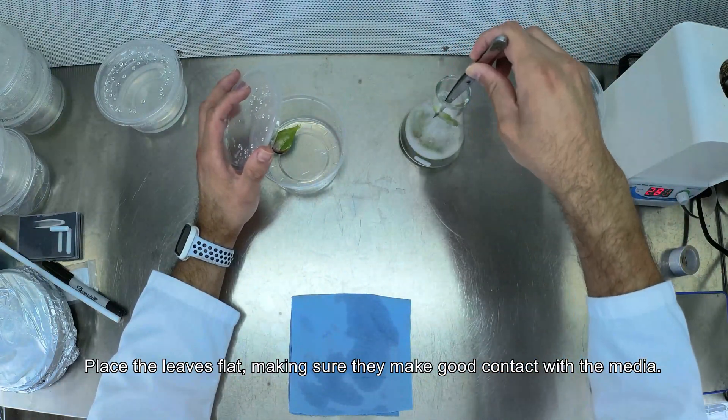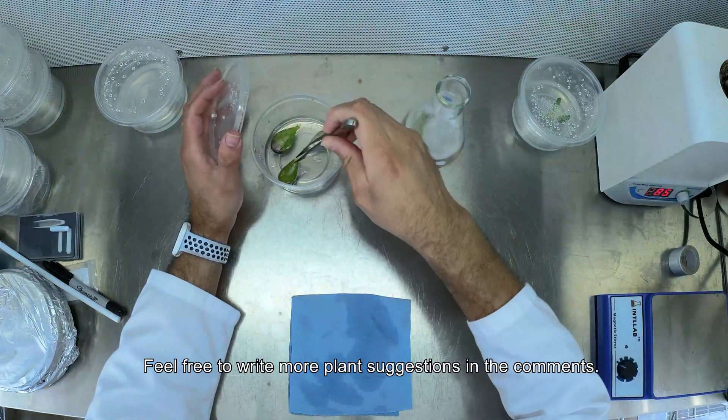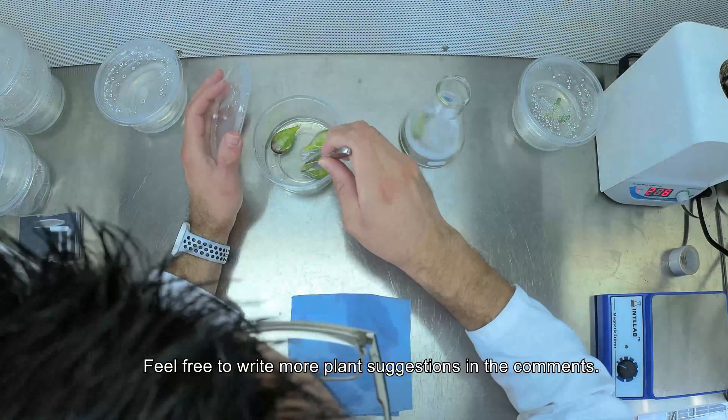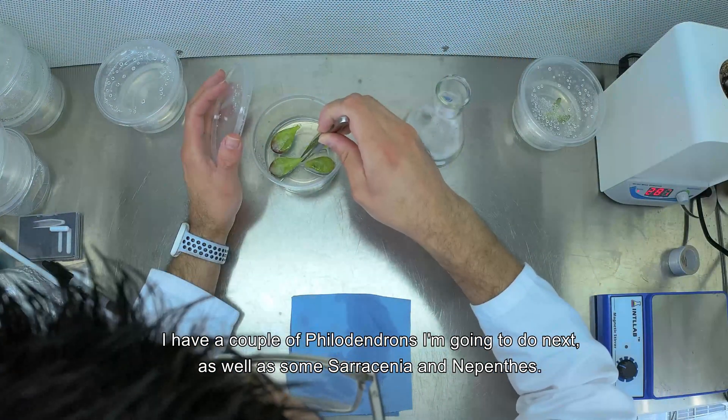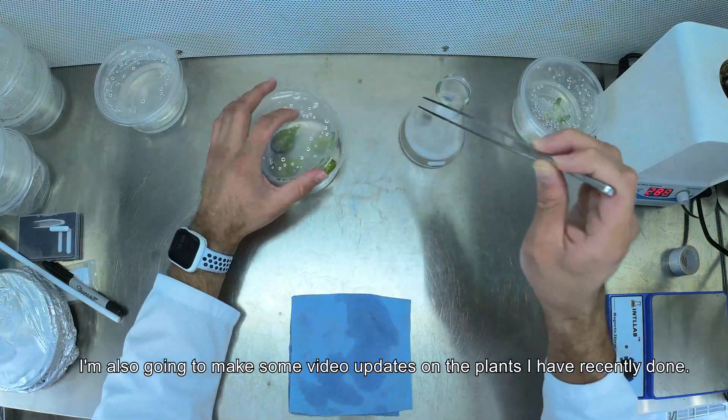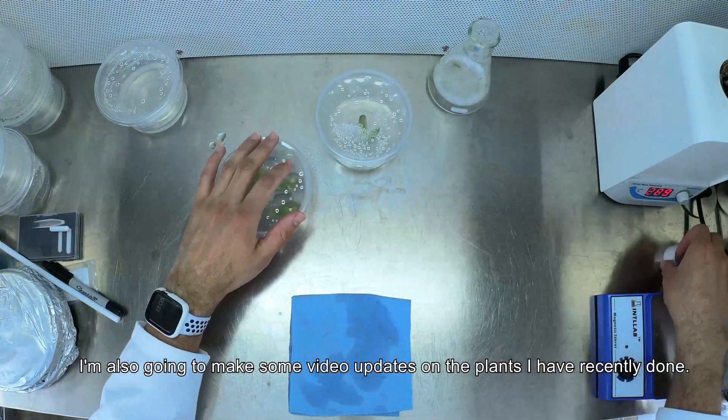Place the leaves flat, making sure they make good contact with the media. Feel free to write more plant suggestions in the comments. I have a couple of philodendrons I'm going to do next, as well as some Sarracenia and Nepenthes. I'm also going to make some video updates on the plants I have recently done.